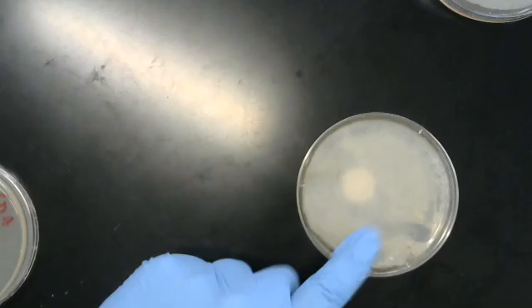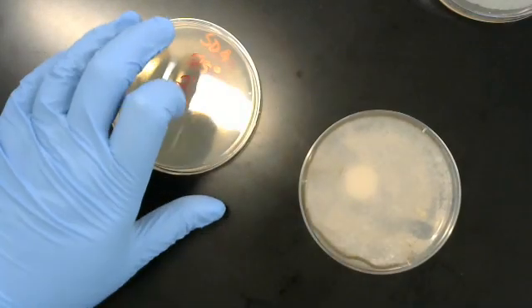Off to the side here, you're just going to have to trust me that I have some fire going. I'm now going to sterilize our loop. We'll do that with our next one and our next plate.